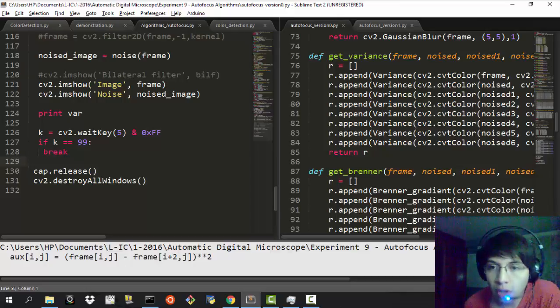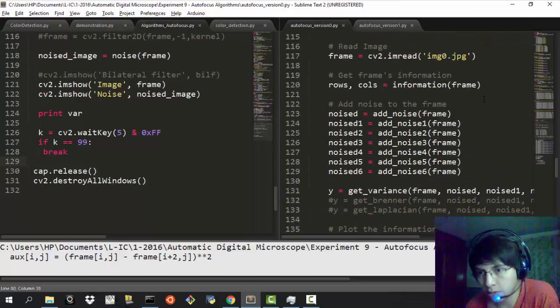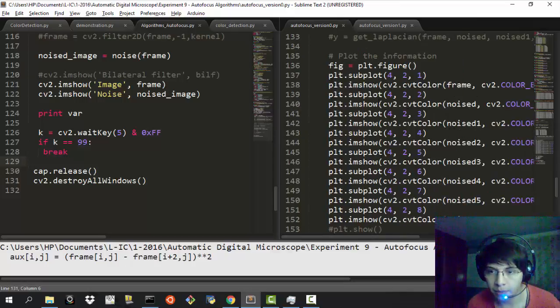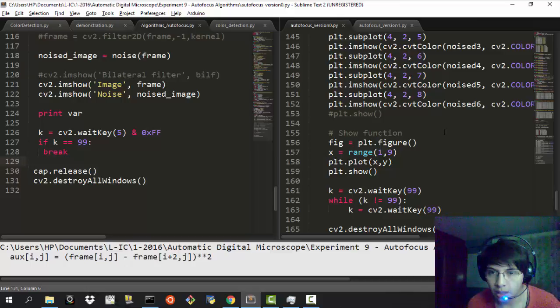One thing that I have to mention before we start is that the images that we are using are being converted to grayscale, so that we don't have to deal with three-dimensional spaces. Besides that, color doesn't seem to help very much when we're making this measure, so it's better to just have a grayscale image, and we can still get a good measure of the focus. Then we just use the matplotlib library to make the plots, and I'm going to show you the curve of the values that we obtained when measuring the autofocus, I mean the focus of the image.